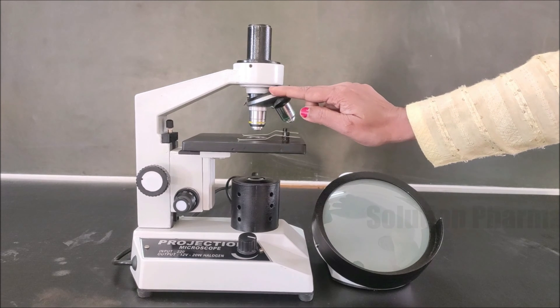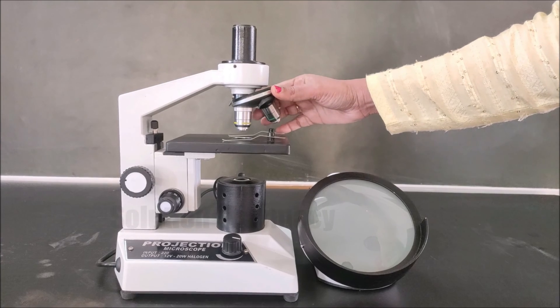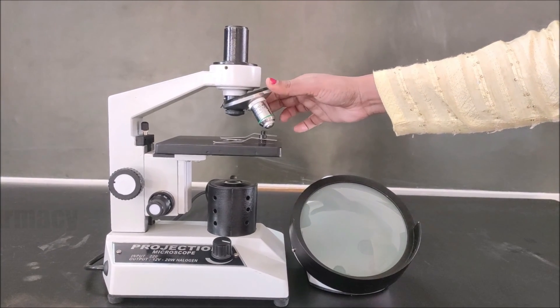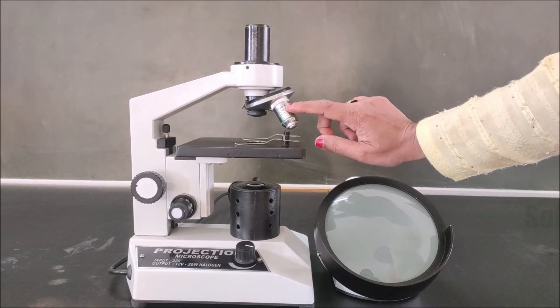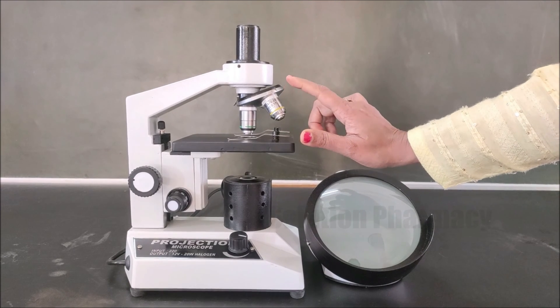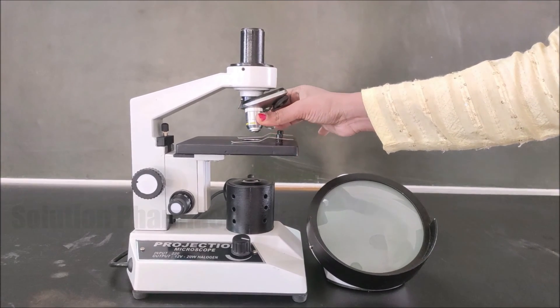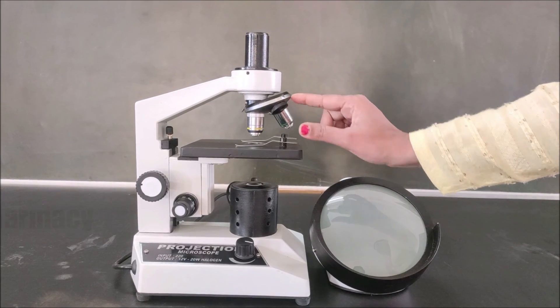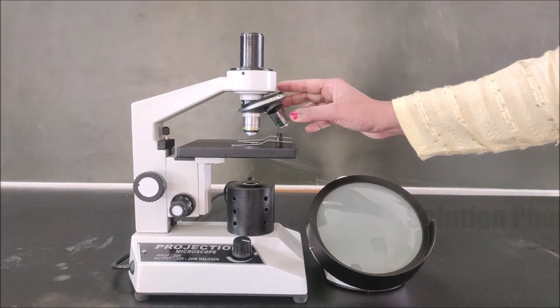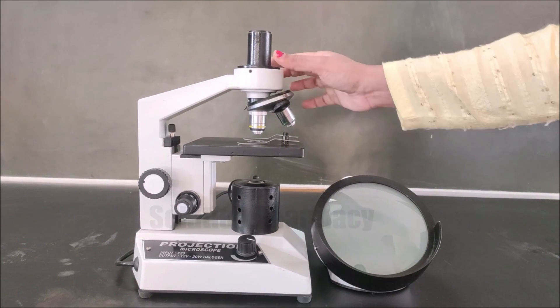This part is called the nose piece, in which the objective lenses are attached. The objective lens magnifies the specimen on the slide, and we can rotate the nose piece to set the desired objective lens of appropriate magnification. For example, rotate it to move the 20x objective lens to the center of the stage, or rotate again to bring the 10x objective lens over the center. This is a triple revolving nose piece that can hold objective lenses of three different magnifications.